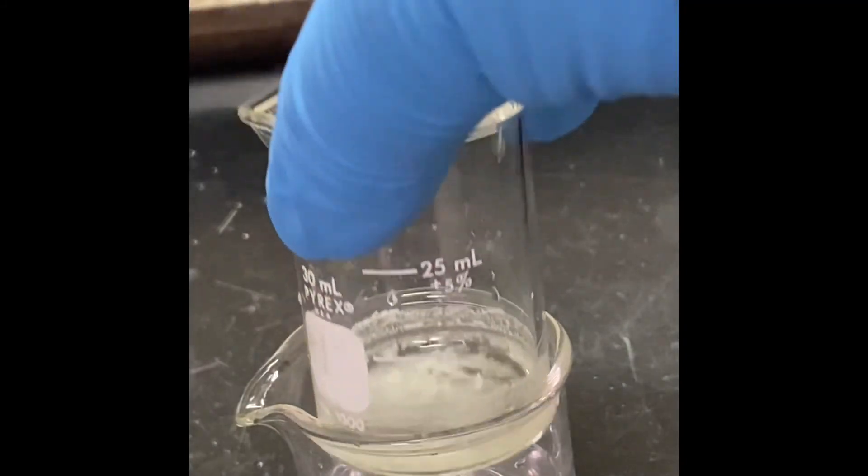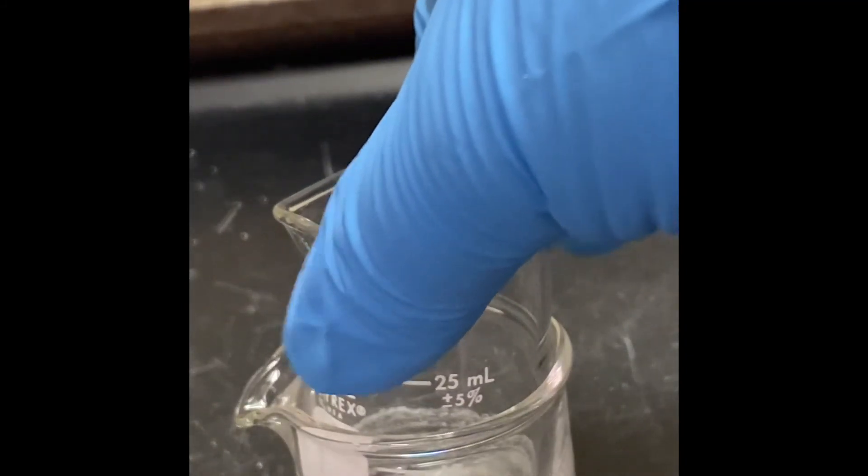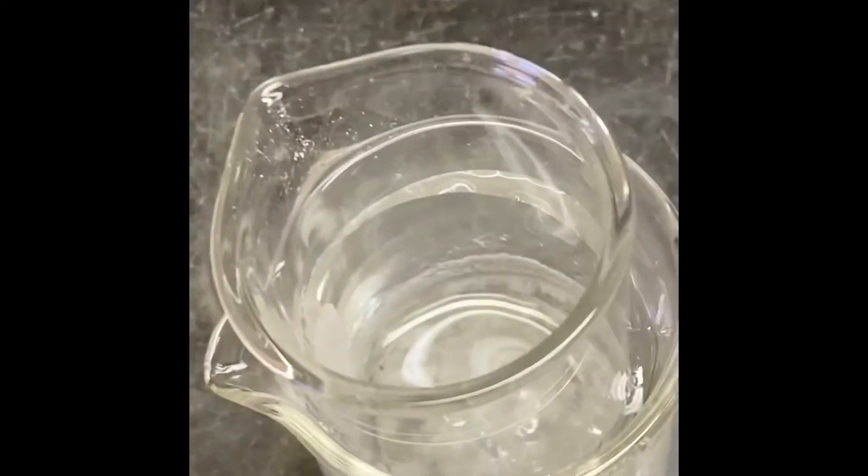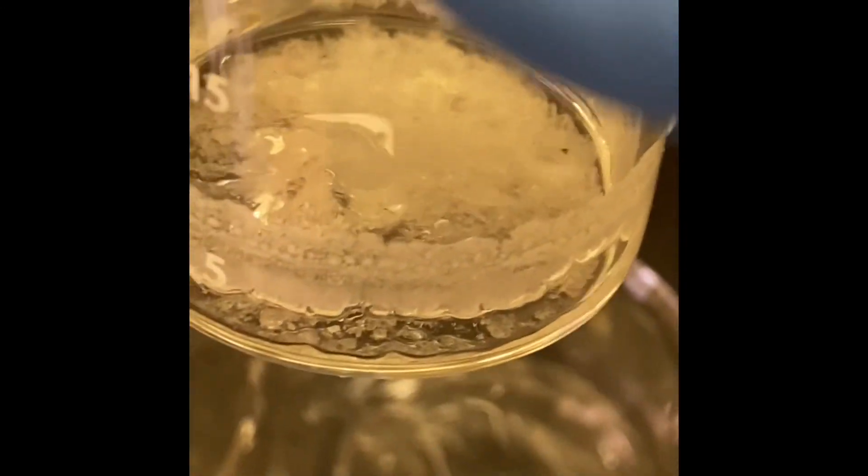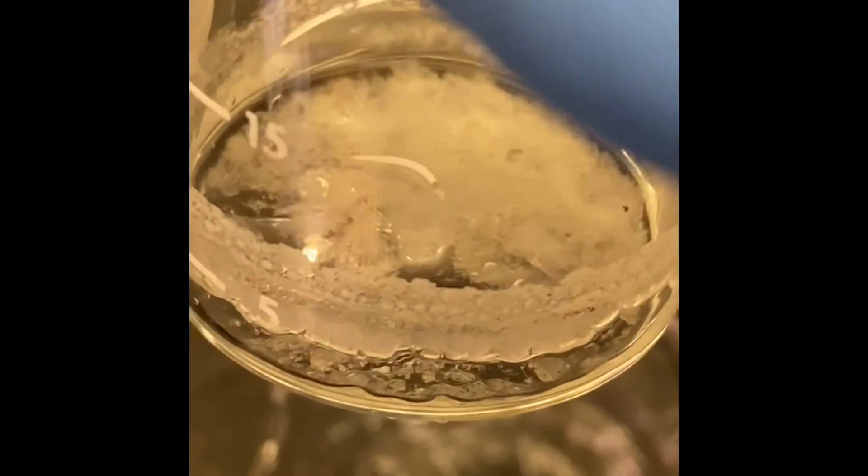That's our crystals. That's our crystals. Now we're going to put that glass in an ice bath. After keeping in the ice bath, those are our crystals. Now we're going to do filtration.